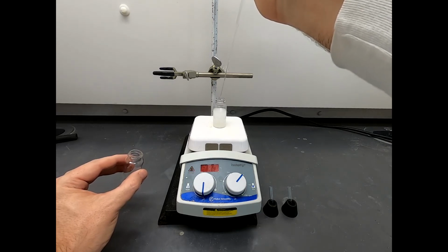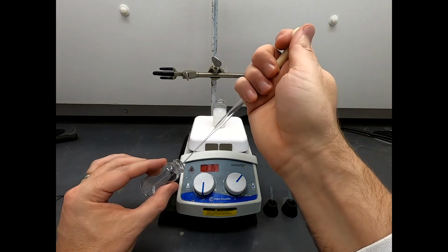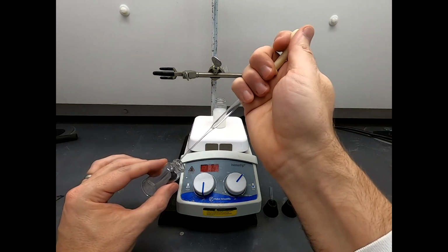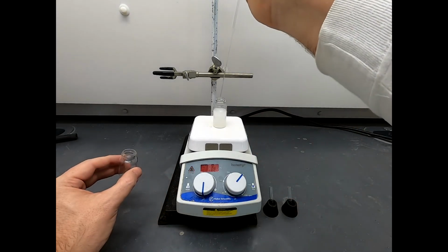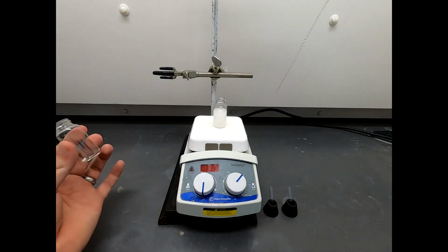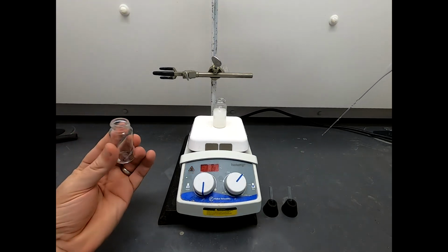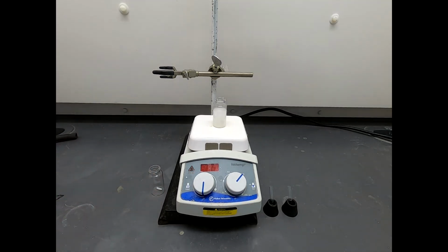Okay, we're almost there. Now the way I'm transferring this, we're going to lose a little bit of residue in here. Yeah, that's just the breaks. There's always a cost in doing transfers. I'm not going to try to add water in here and transfer it over. We're just going to leave that as is. I mean, we got 99.5% of it. I think that's adequate for what we're doing.